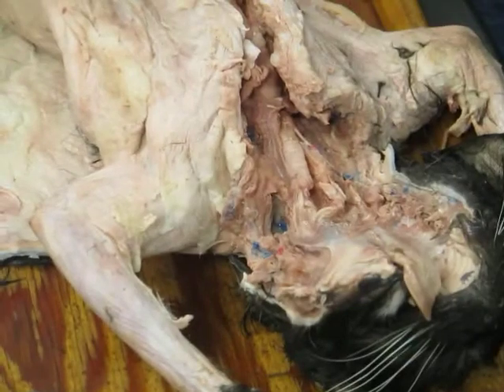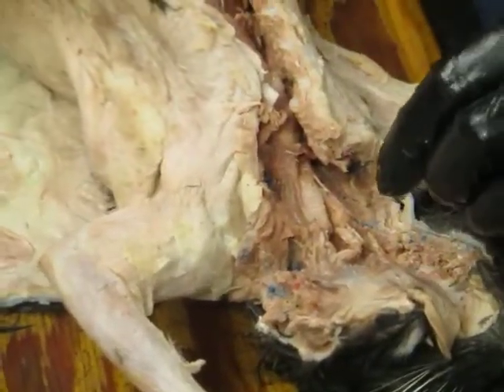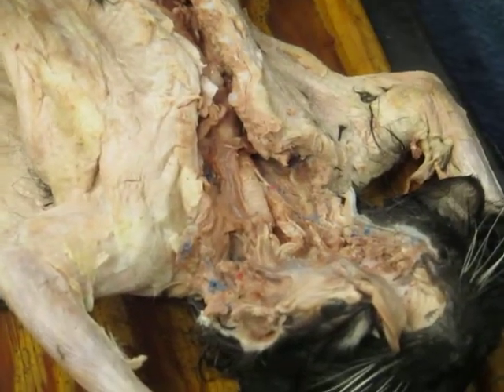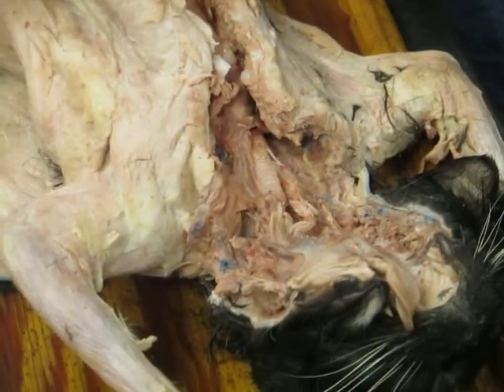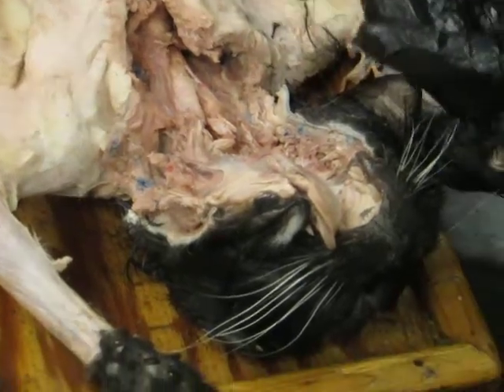And there's one on each side, and those two vocal cords, the left and right, can be put right up against each other. Lisa, did you get it? Are you good enough? Okay. All right. They can be put right up against each other and close off the airway. And that technically is the glottis, where the two vocal folds come together in a mammal. So it looks pretty different from the glottis in a frog, let's say, or a snake.